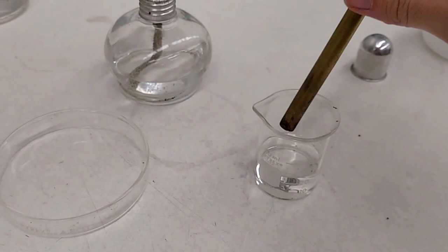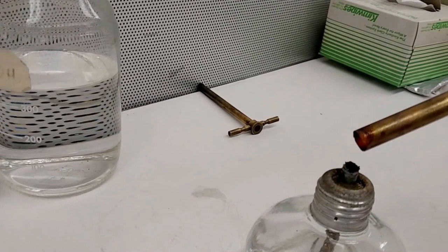So the first thing you're going to do is you're going to have a, in this case I have a number five borer. What I'm doing is I'm dipping it in ethanol and then lighting it. That is to kill all the bacteria and also fungal spores that I used earlier.